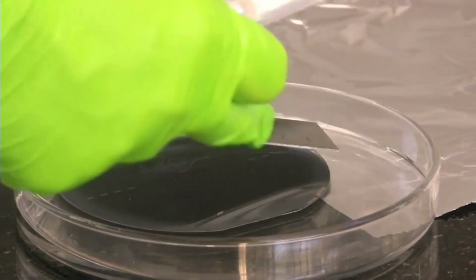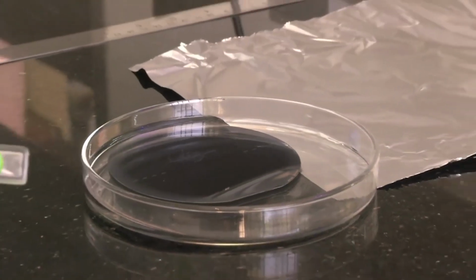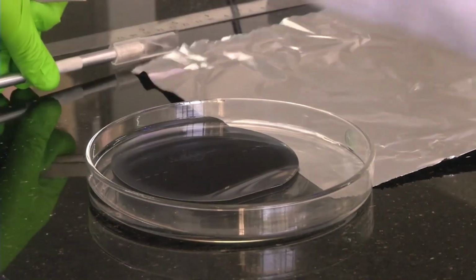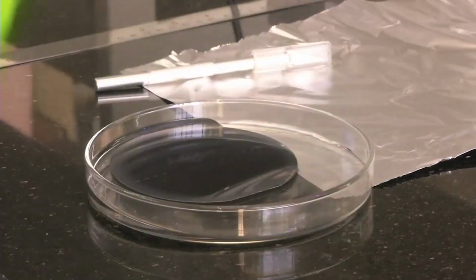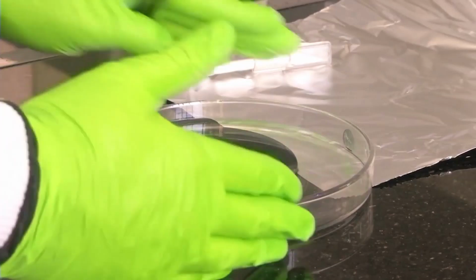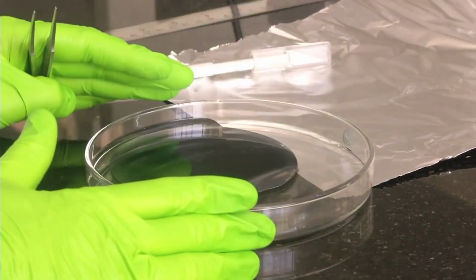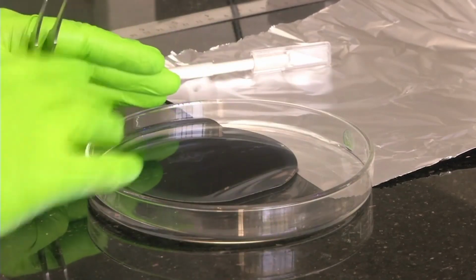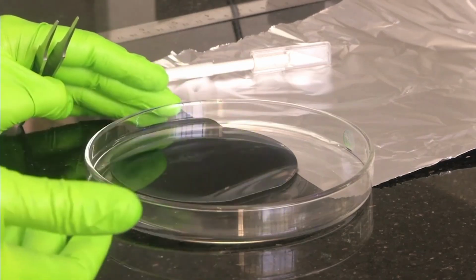A metal scale to take your measurements, steel tweezers so that you can peel off the PDMS membrane from the glass slide, and finally you need to have aluminum foils because once the mold is formed, the mold gets stuck onto your glass plate, so that you have to reuse your mold. To reuse your mold, you have to cover your petri dish with aluminum foil or some sealing material. Otherwise, a lot of dust will get settled on top of the mold and it becomes non-reusable. So let's see how we can cut out.